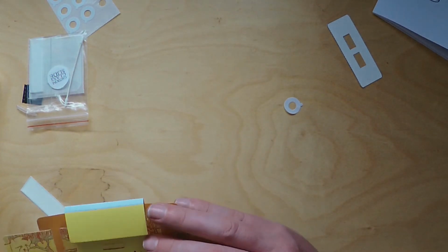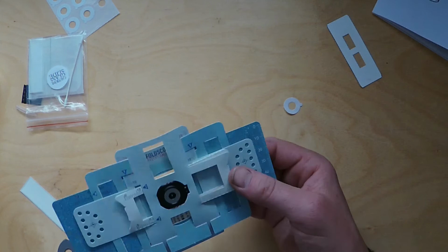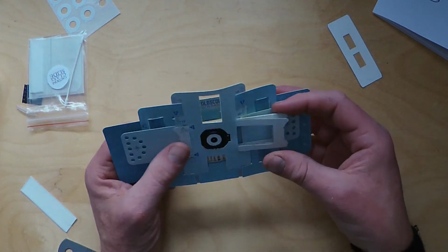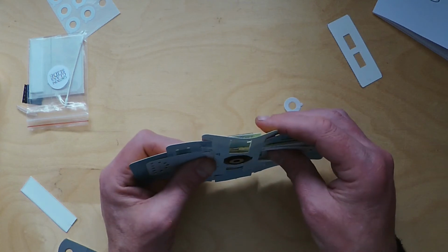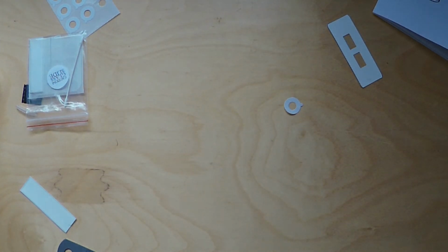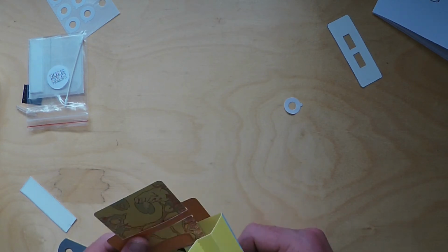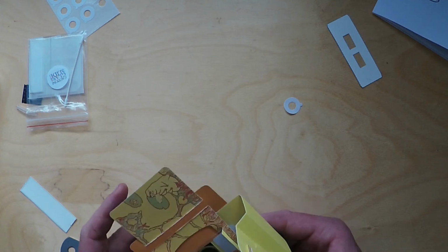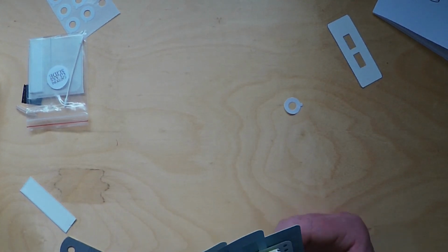So we've got our slide. Now if you hold that up to the light, up to your eye, with your thumbs there, you should be able to see the sample. If you can't, you need to play with the focus ramp, and I always like to start off quite low, so right to the end, and hold it out to the light, up to your eye, see if you can see the sample. Sometimes it's best to check it's in position first, and then try it from there. So I think I'll pause this video.